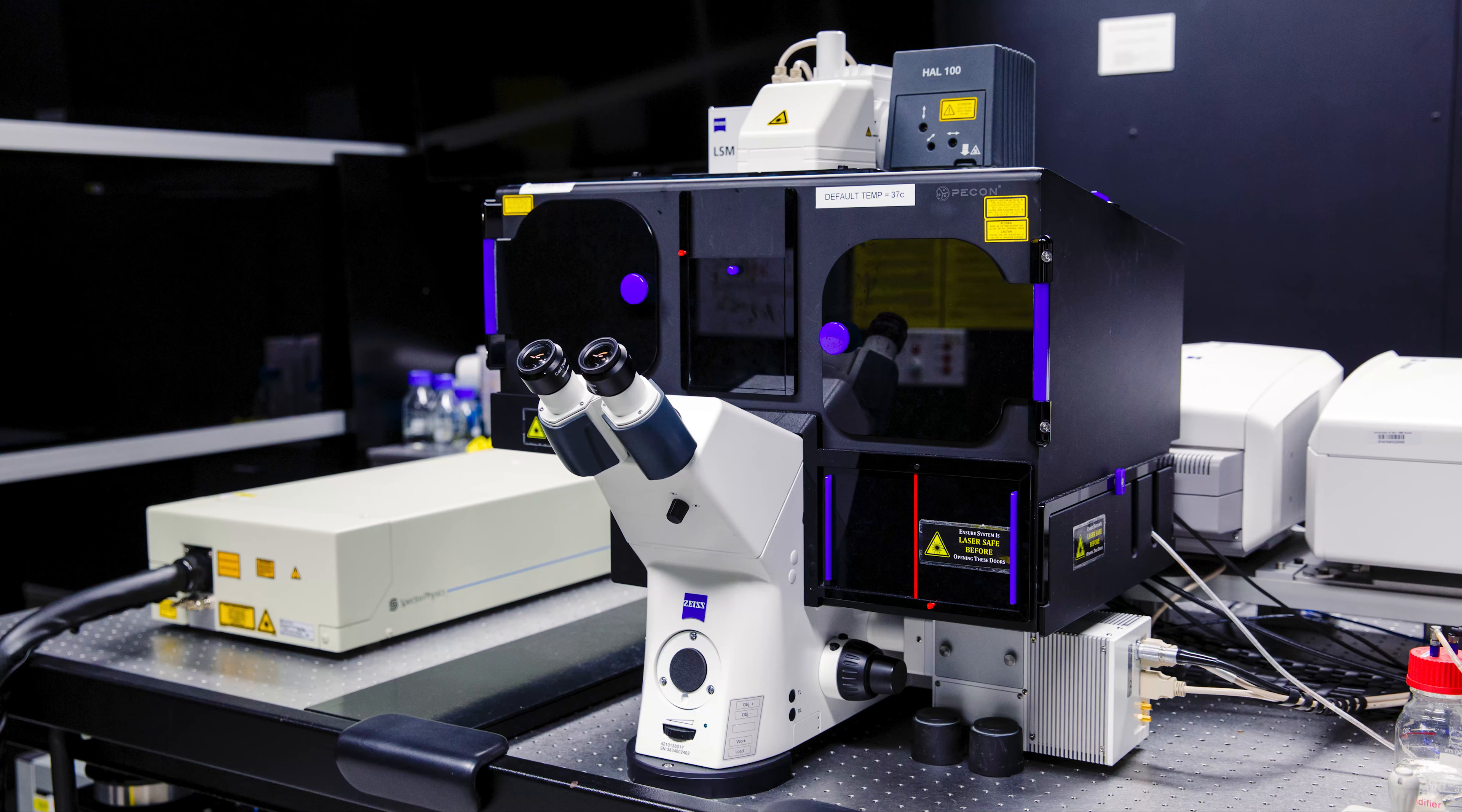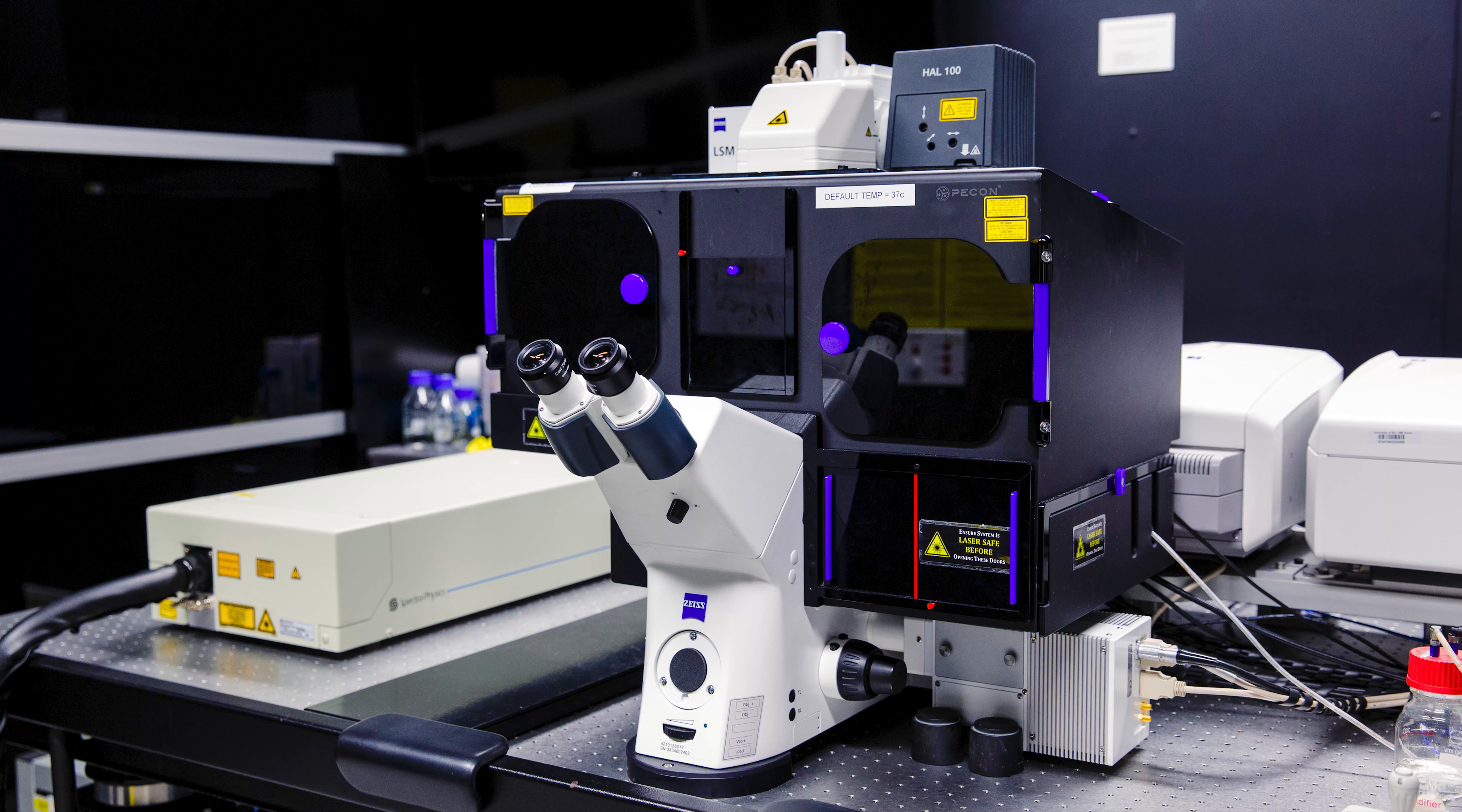This video series will go over the training for our Zeiss LSM Confocal Microscopes at the ACRF Cancer Biology Imaging Facility at the Institute for Molecular Bioscience, the University of Queensland, Brisbane, Australia.